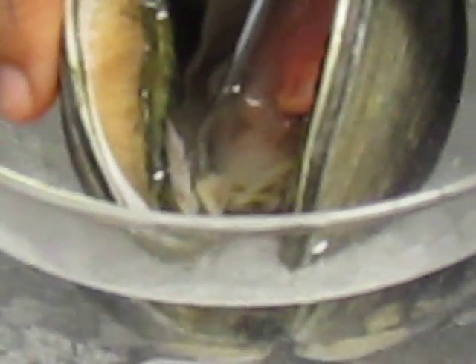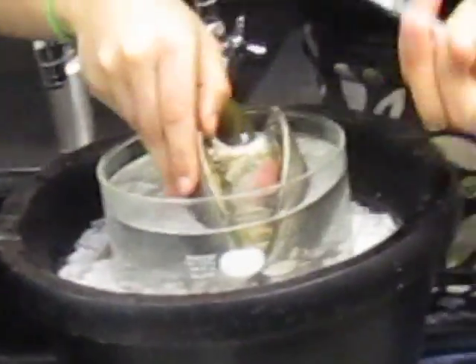Why don't you do groups of two? So you two, come closer. Let's see. Right up here. So see these white, flappy, longish things right there? Yeah? You see? Okay, so those will basically bring in food into the mouth.